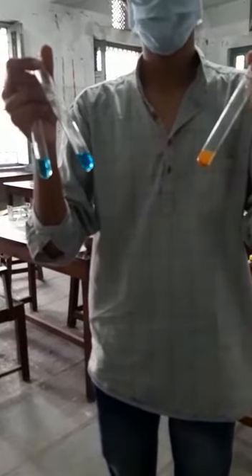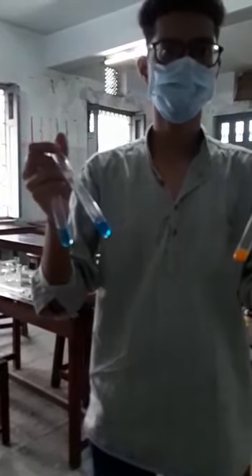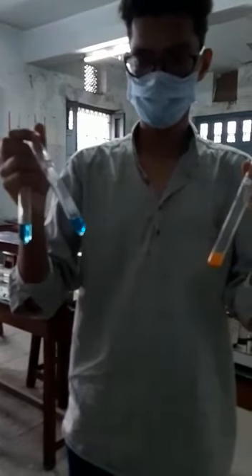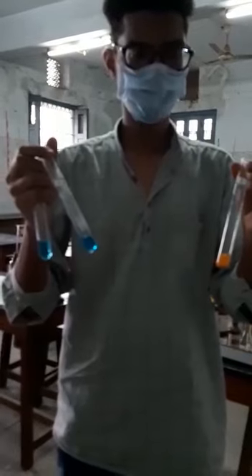After boiling the samples, wherever the glucose molecules are present, it has changed to orange color, but when there is no glucose, the Benedict's reagent remained as it is. There is no change in the Benedict's reagent. But when the glucose is present, it has changed to orange color. That is the confirmatory test for the reducing sugars. That ends your carbohydrate analysis.